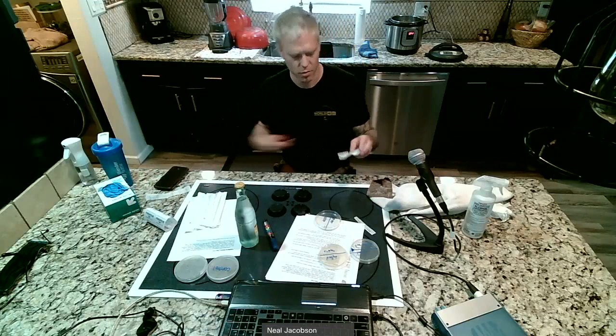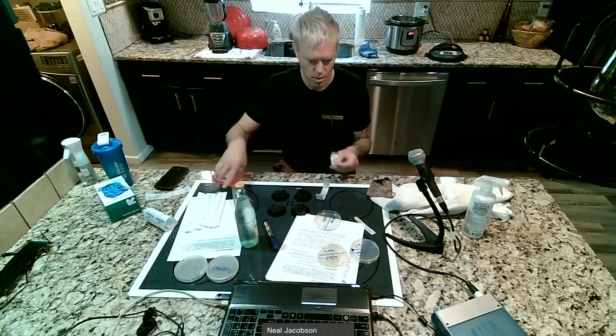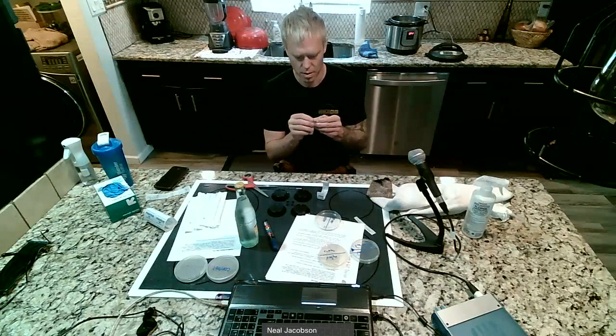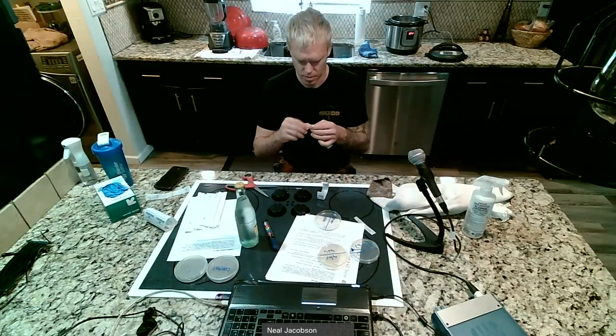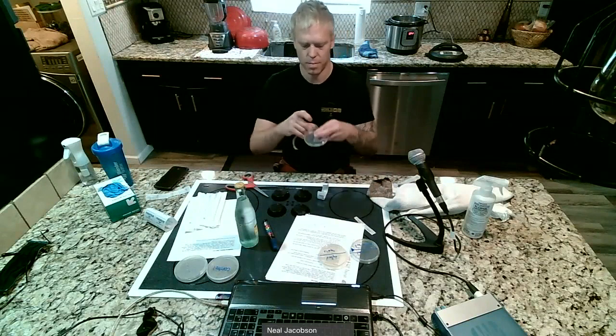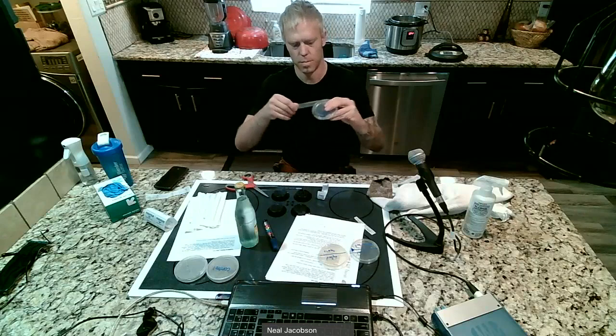Okay, then we'll take our parafilm, we'll cut another strip. And then immediately we want to seal this up because we don't want any outside bacteria. We don't want any outside spores to fall onto the plate. So my ear and nose is done. Just gonna wrap that around.